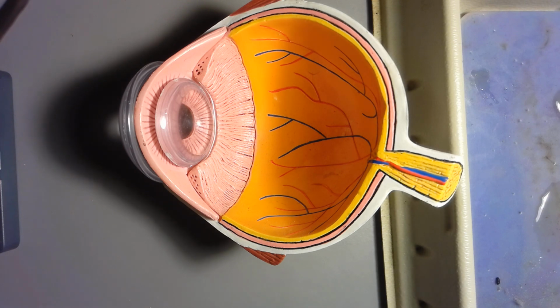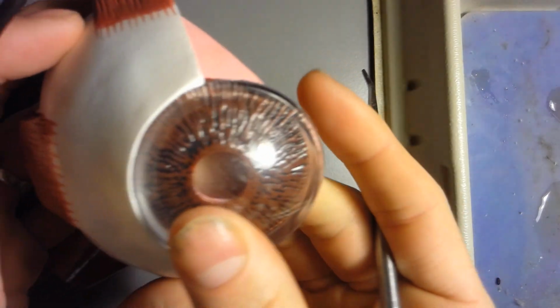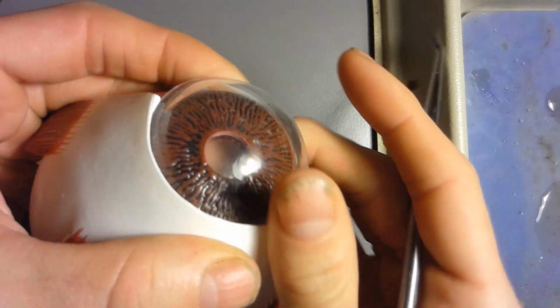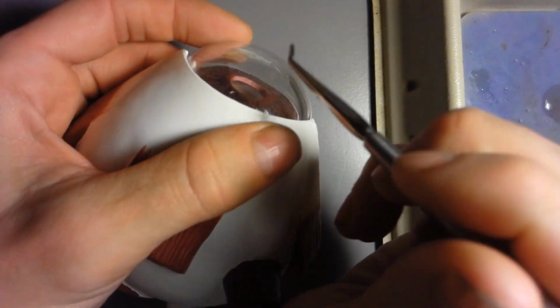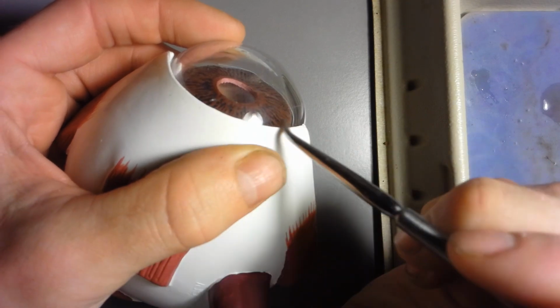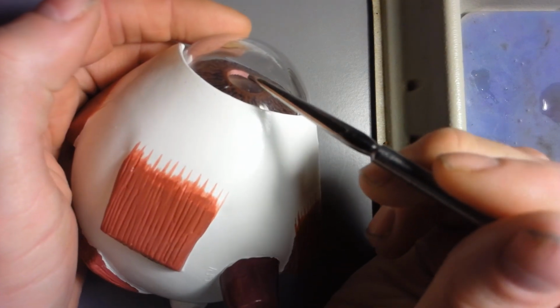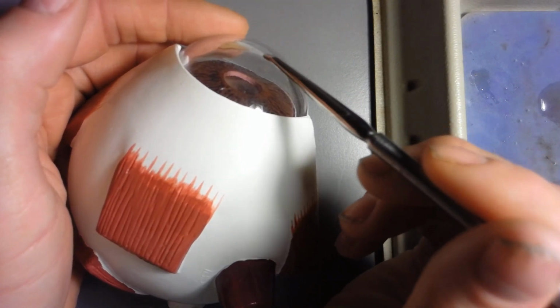Alright, so starting off with the parts of the eye external. So I'm going to be flipping this eyeball over here. Okay, and so starting off with the first one would be the cornea. The cornea is right here. It's the clear structure of the eye that's anterior to the pupil and the iris. So this right here is the cornea.